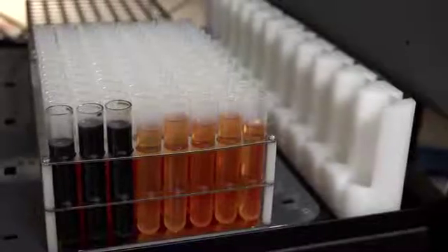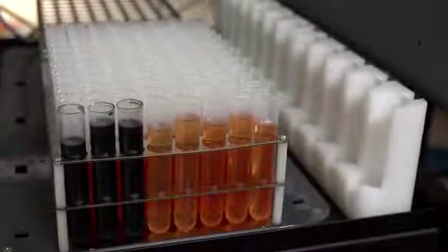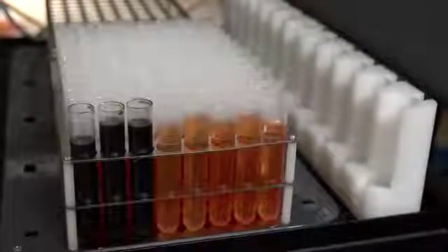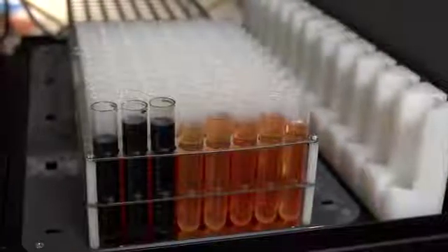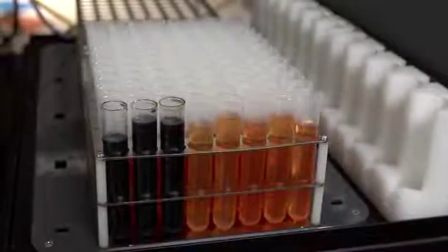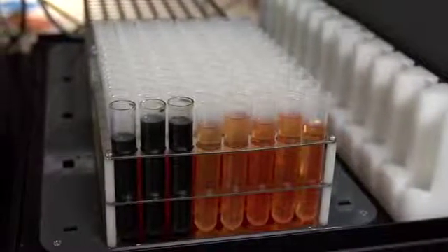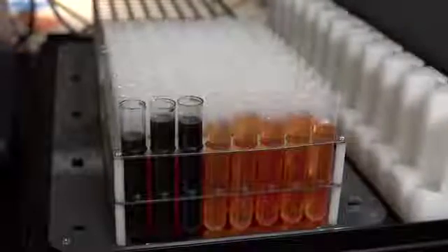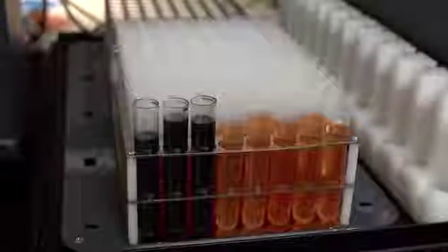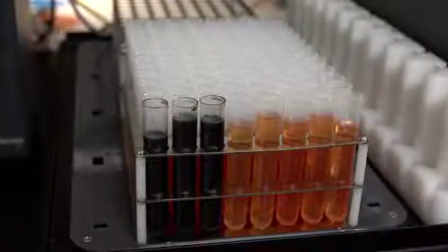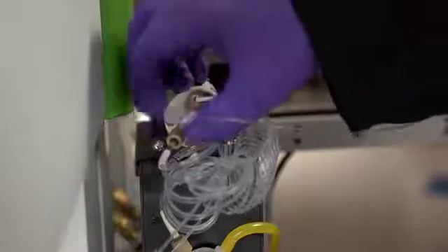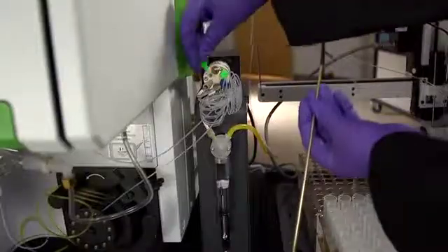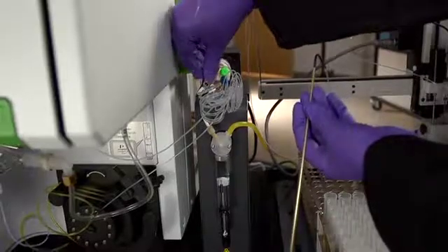A set of engine oil samples only analyzed for ICP can be run after a set of particle count samples, but the user should be wary of running these samples through the particle counter cell as these can dirty the cell and cause inaccurate particle counts to be reported for the next batch of particle counting samples. It is better practice to disconnect the lines from the particle counter cell and reconnect them with a clear connector when running dirty samples.